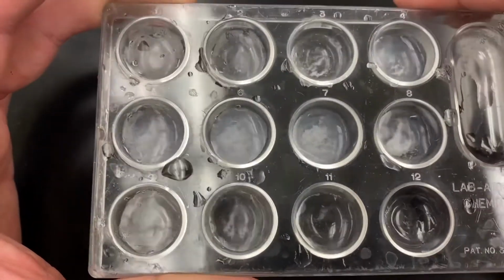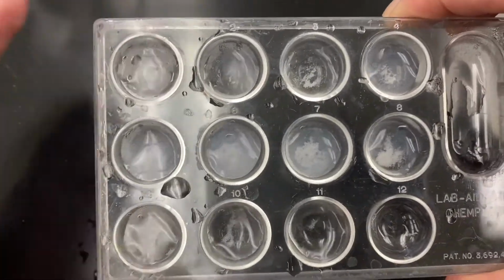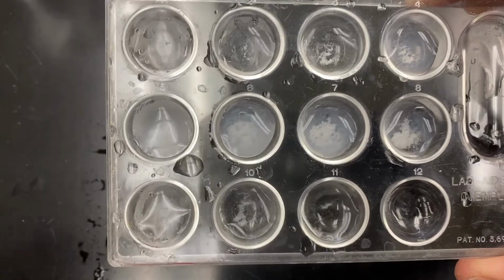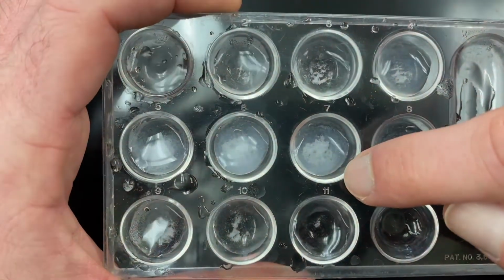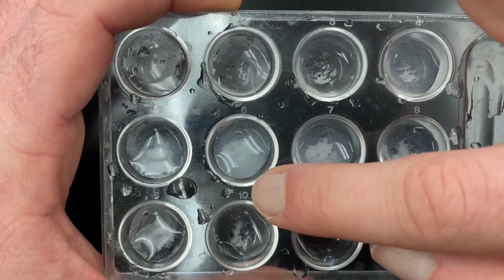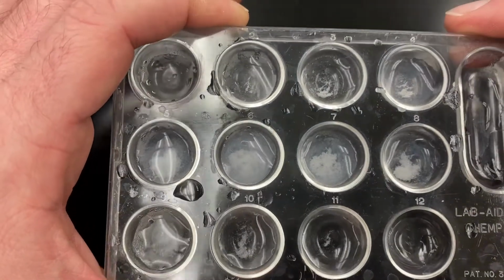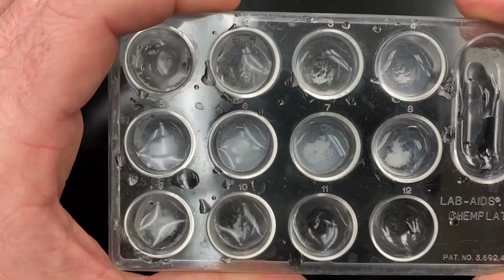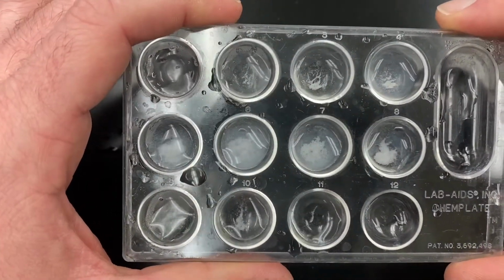So because chemical equations typically balance with small number ratios, while our result looks to be about 7-to-5 yielded the most, I think if we let this one settle, we'll find that the 6-to-6 ratio or the 1-to-1 ratio is going to yield the most precipitate. And so we could record that as a result. A 6-to-6, 1-to-1 ratio is going to be the most effective.